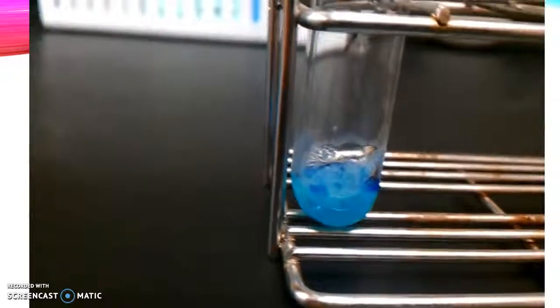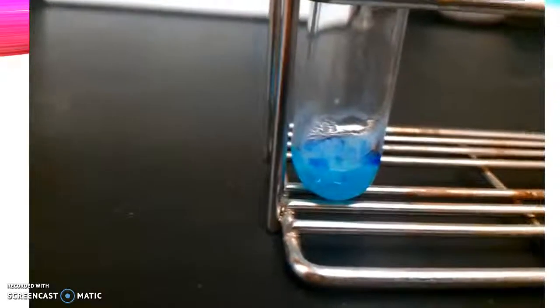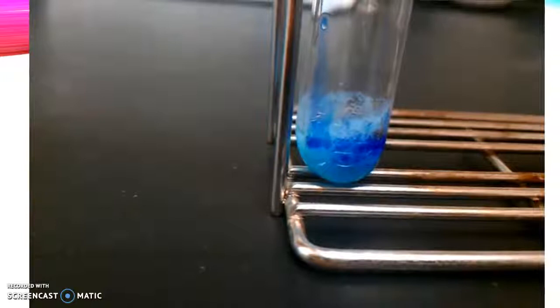So what we've done now is add about 2 drops of aqueous ammonia to copper-2 nitrate, and you get a light blue gel, which you can observe. Now we're going to add more ammonia and see what happens to this light blue gel as we continue adding ammonia. This is the next point of the video. As you can see, the solution starts to turn a clear, dark blue.